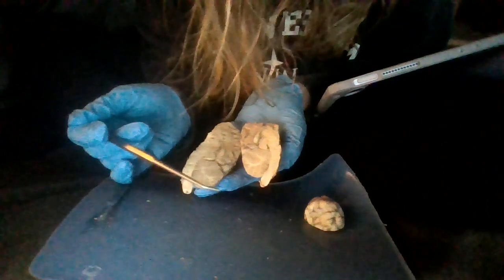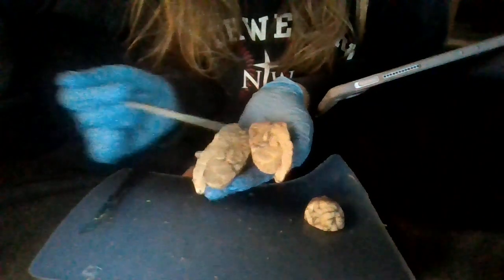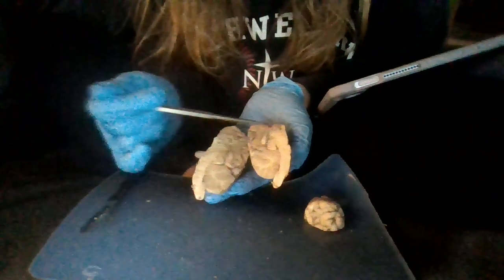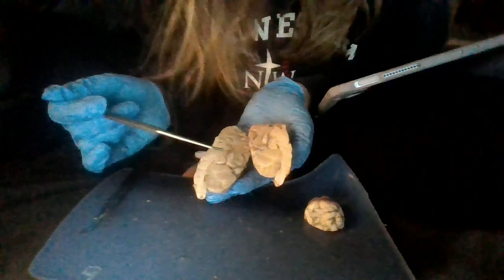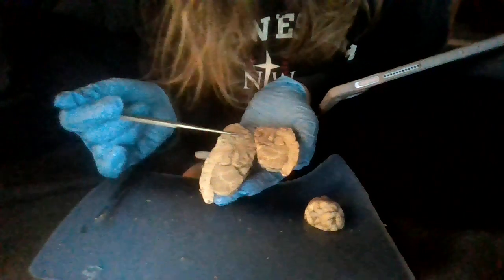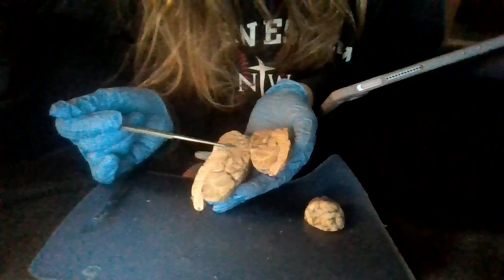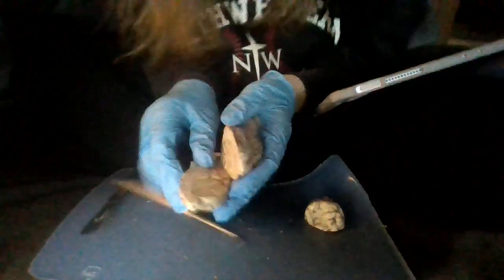And then we have our corpus callosum, which is going to be this lighter shade here. Then we have our septum pellucidum, which is going to be the middle part of that, kind of in there. And then we have our sulcus, which is a groove, and it should be right here, I believe. Then we have our gyrus, which is going to be right there below it. And I believe that's all the parts we need to label and point out.